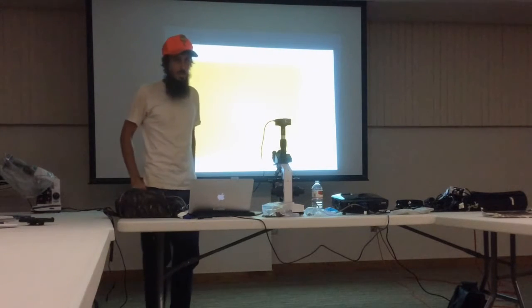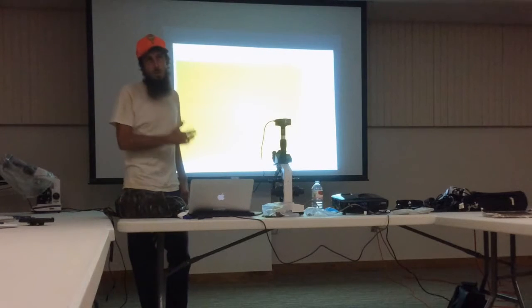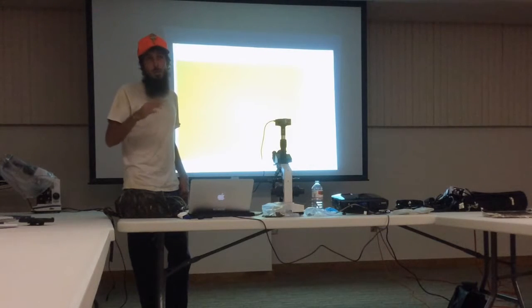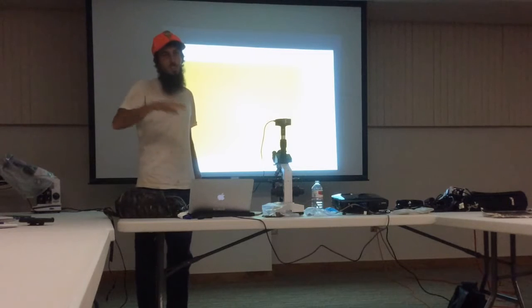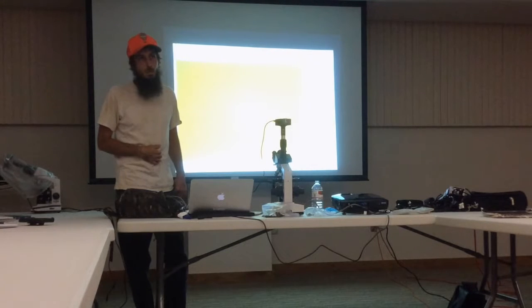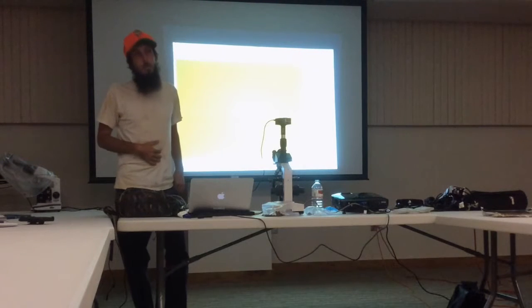So that was one per every view. If you saw one fungus per every view, then you would have equal parts, you think? Okay. Yeah. And also, like you saw, I was cruising around, and I saw predominantly beneficial fungus as well. And so that's another thing. If I'm seeing predominantly not beneficial fungus, then I know, well, you should make actinobacteria to go in and they kind of clean the slate for you. When you say one fungus per view, what's your magnification? 400 times. 400. Yep.